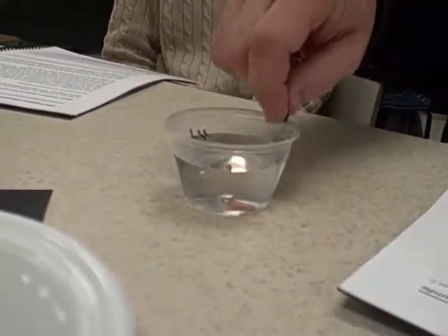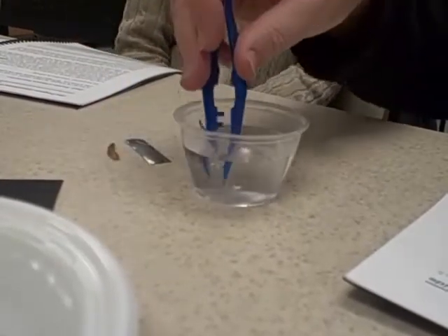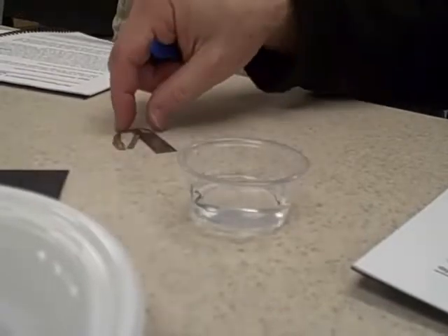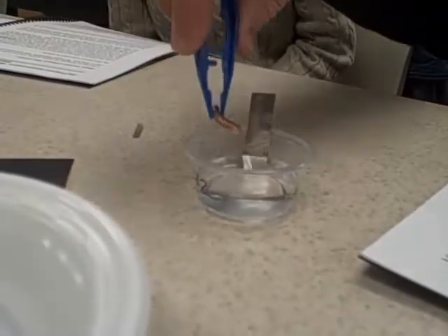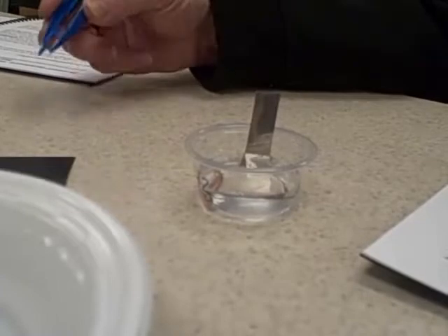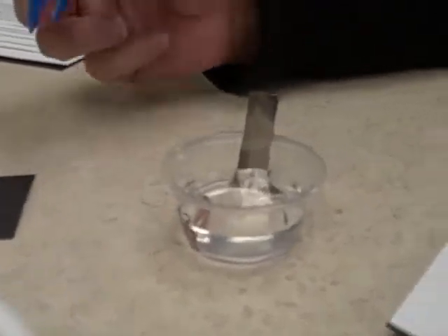Okay, get the tweezers now. There's tweezers around here someplace. Right up there, Helen. Fish those samples back out. And now put them in the cup marked 4-2. This is acid. You're supposed to be observing these now. Anybody see any reactions in the water? No reactions of those metals in the water. Okay, so now put them in the acid in cup 4-2 using the tweezers. One metal sample at a time. Give it 30 seconds or so to see if you get any reaction with the hydrochloric acid.